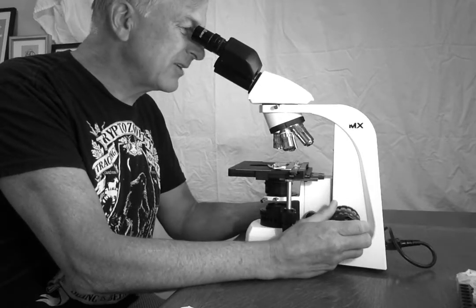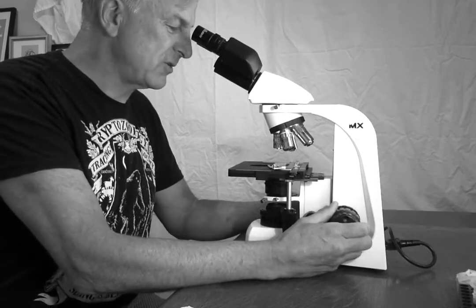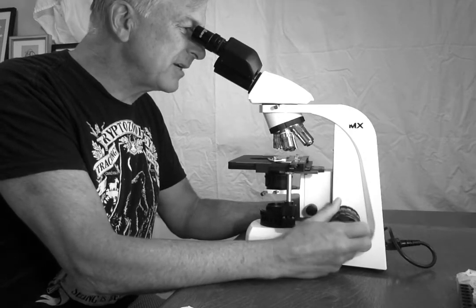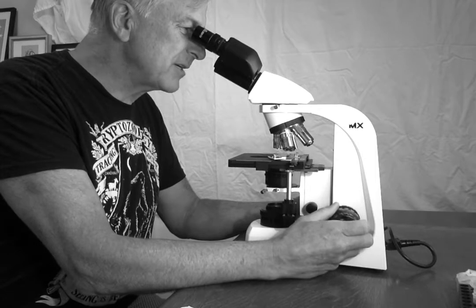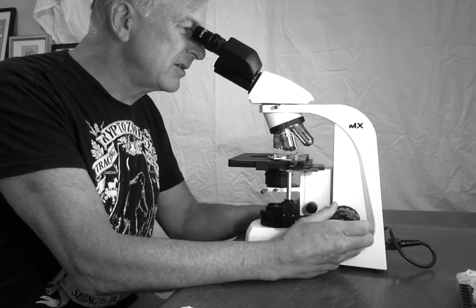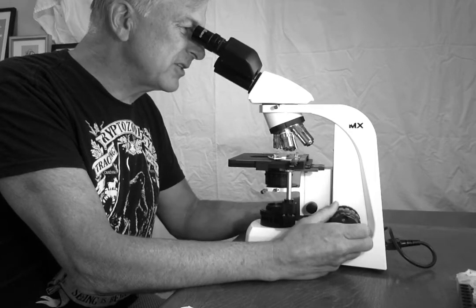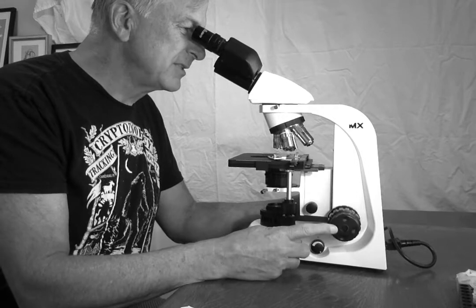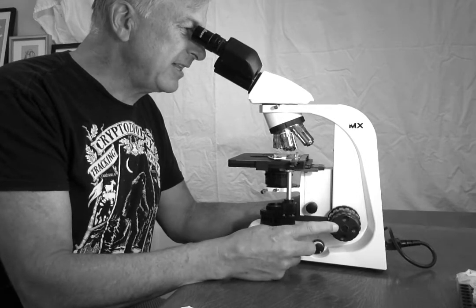I am now going to try and focus it using the coarse focus knob. And I'm going up and up and something's coming into view. Something's coming into view. I'm using the coarse focus till it looks pretty good. Now I'm going to play with the fine focus knob. And that looks pretty good.